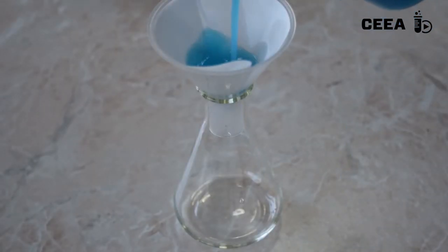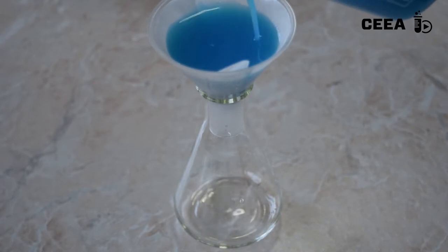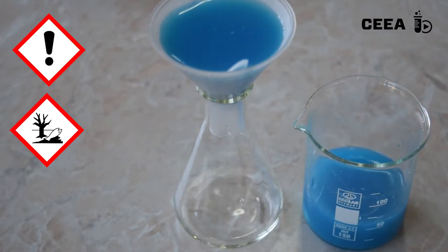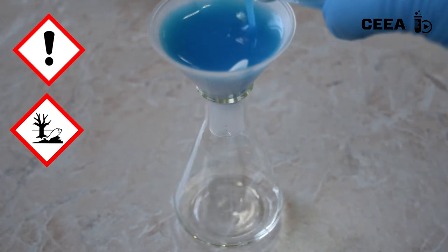Filter this precipitate to discard the sulfate ions remaining in the mother liquor. Take into account the irritant properties of copper salts and their harmful character for the environment.